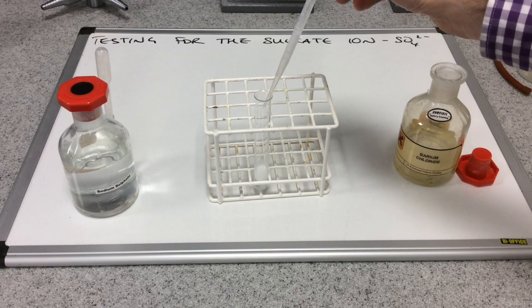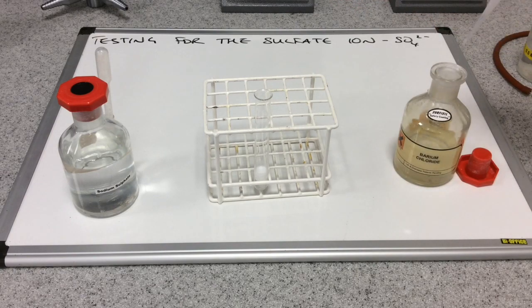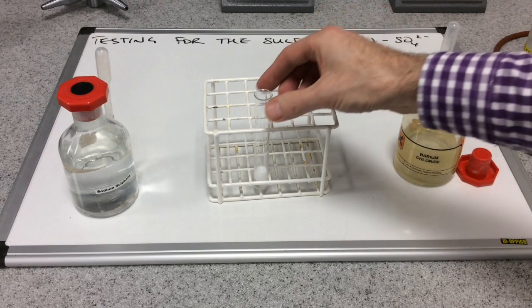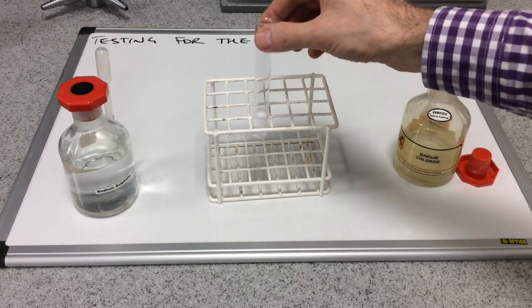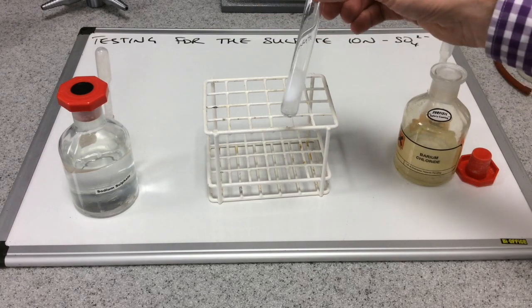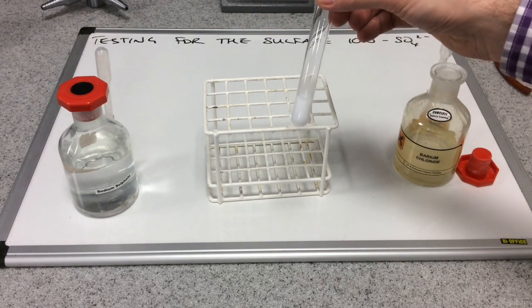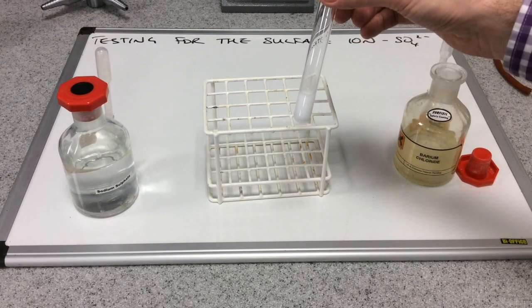Hopefully you can see what's happened there. Just lifting the test tube up to show you — we've got a white precipitate.